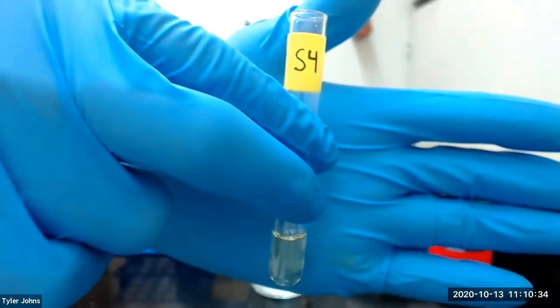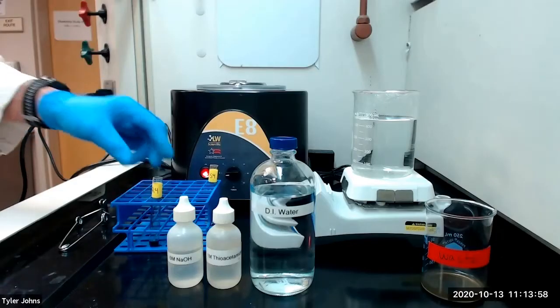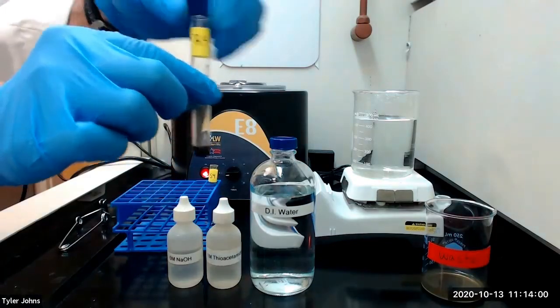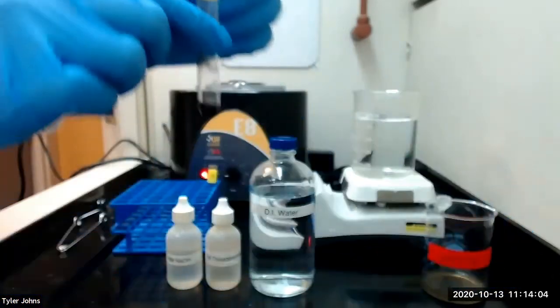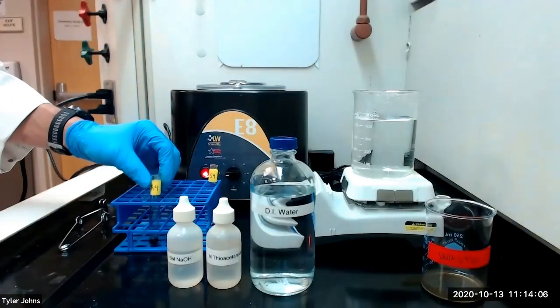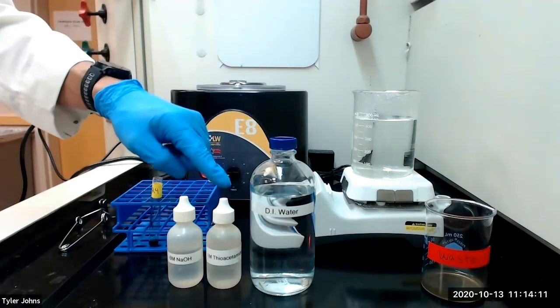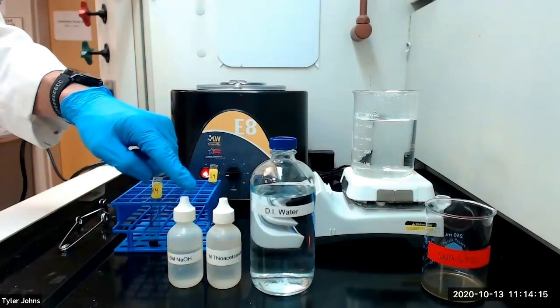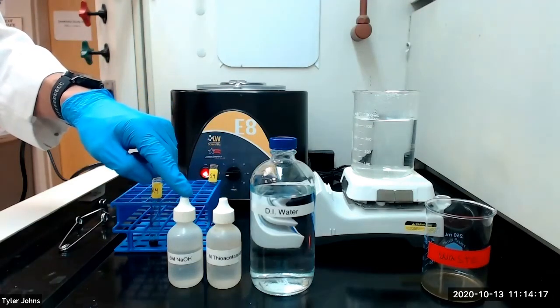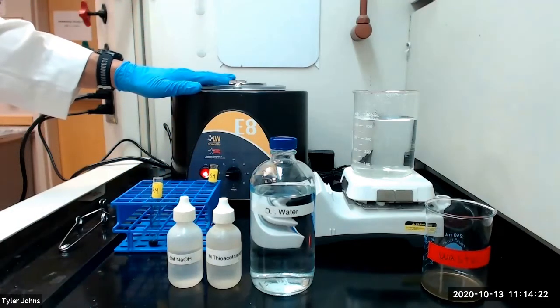We will save solution S4 for analysis of the tin 4 ion. I have relabeled our residue as R4 for residue 4. To R4 we're going to add 3 milliliters of deionized water, 1 drop of 1 molar thioacetamide, and 1 drop of 6 molar sodium hydroxide. We'll stir well, then centrifuge and discard the washings.